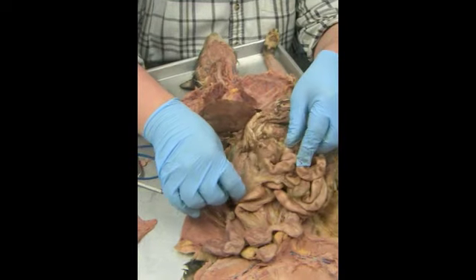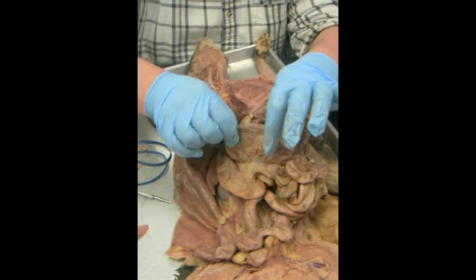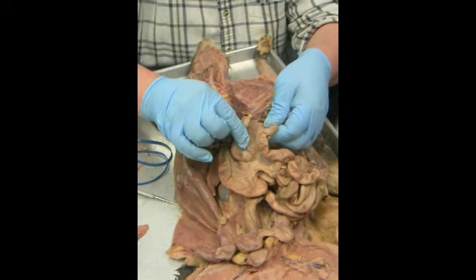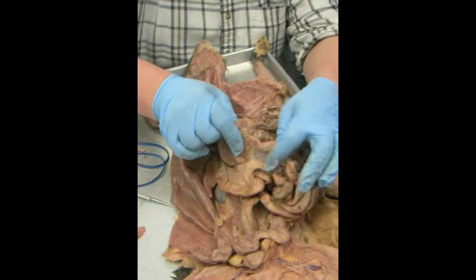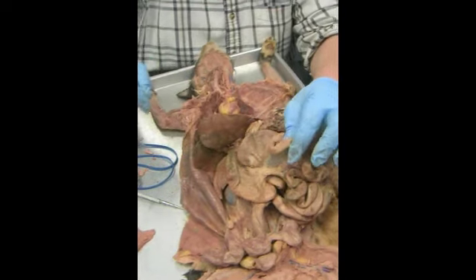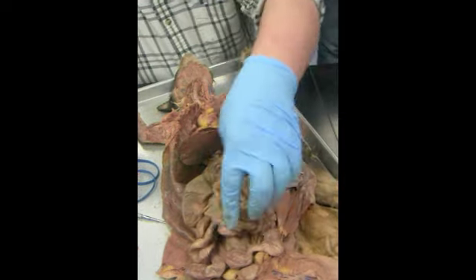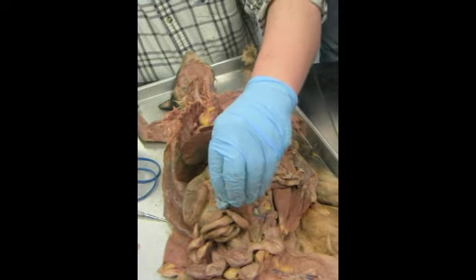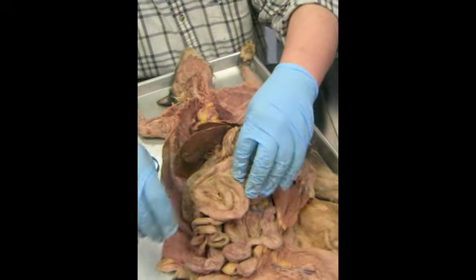We push this down. The next tube is going to be our ascending colon, large intestine. It has a little nub on it, which is called the cecum. Coming into it is the ileum, which is the small intestine. The middle part of the small intestine is here. It's the jejunum. Keeping it all in line is the mesentery, connective tissue.